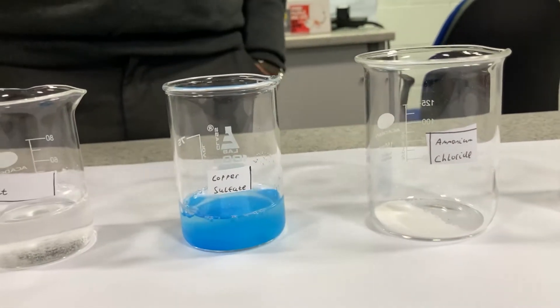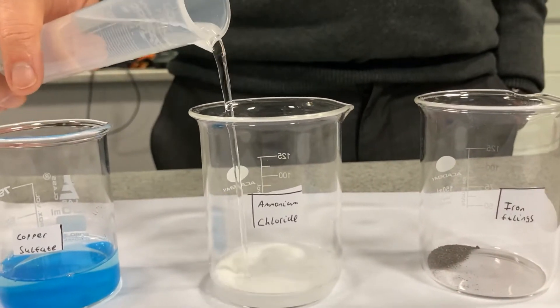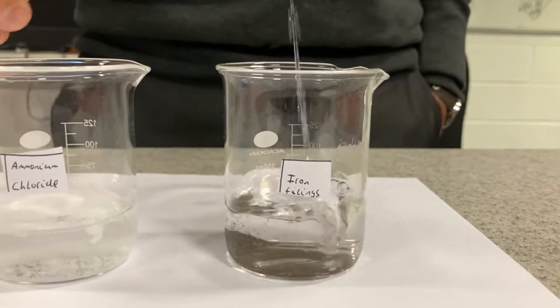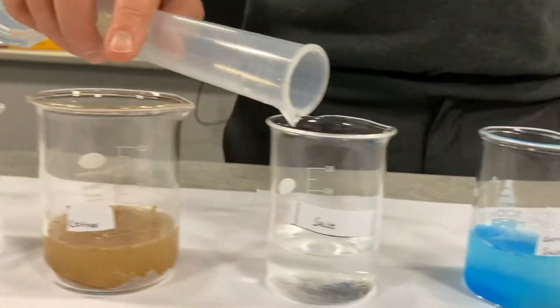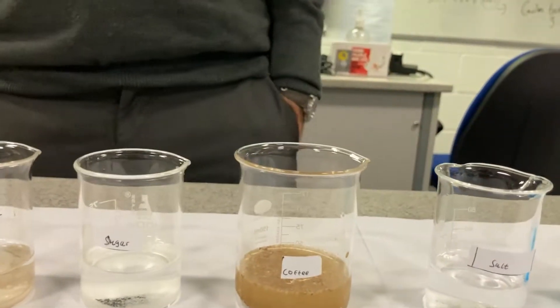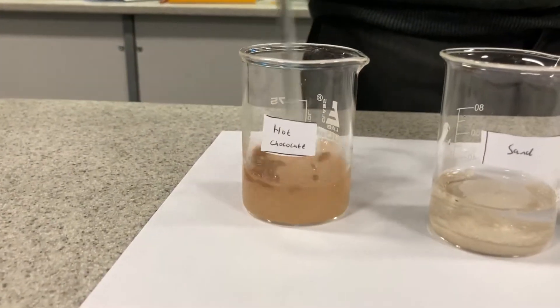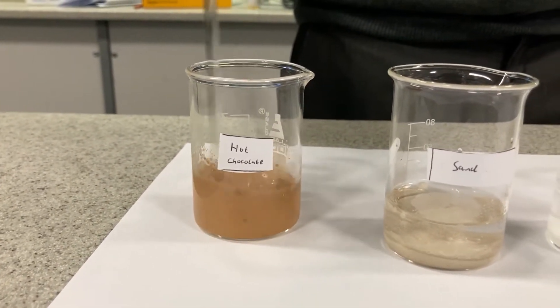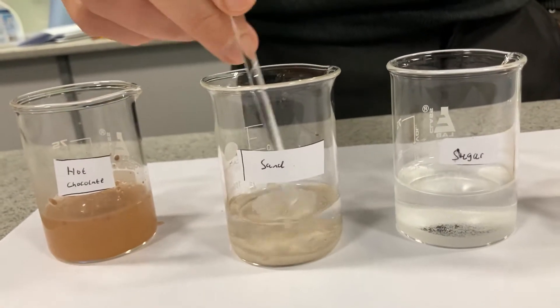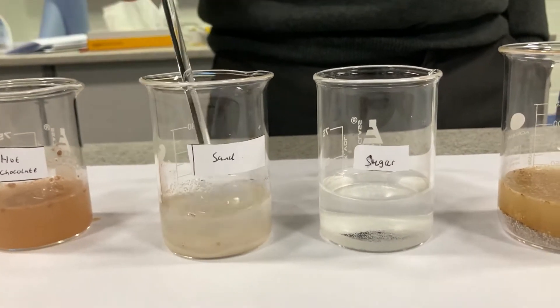Let's get some more water and top them all up a bit. I'll give them all a quick stir, and then I think I'm going to give them a minute or two just to settle.